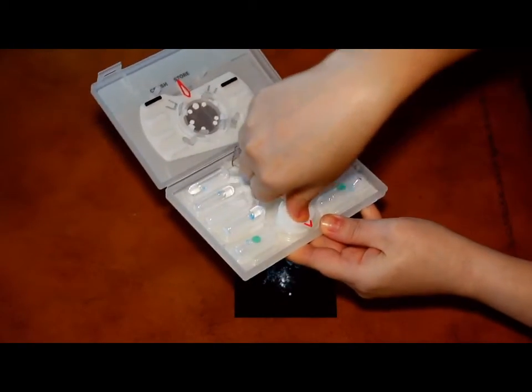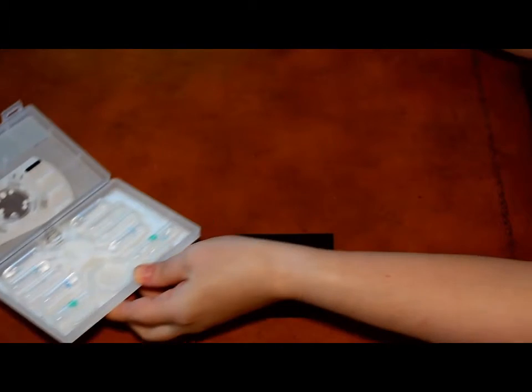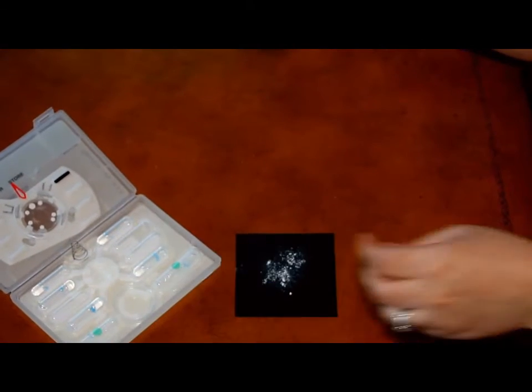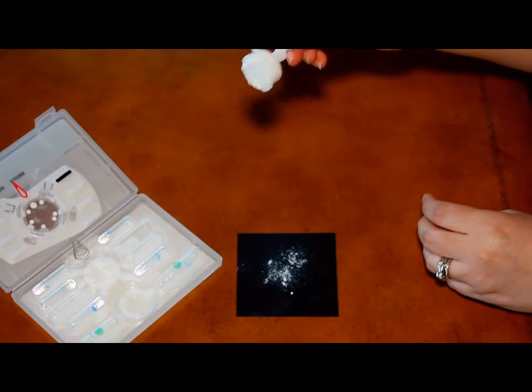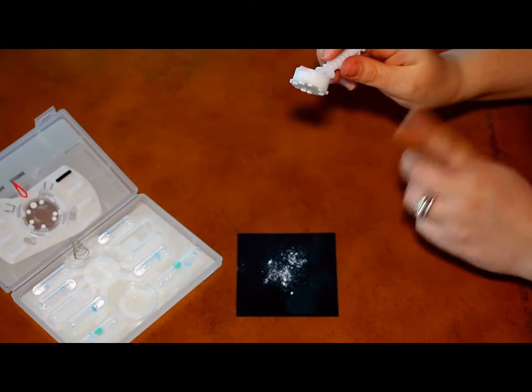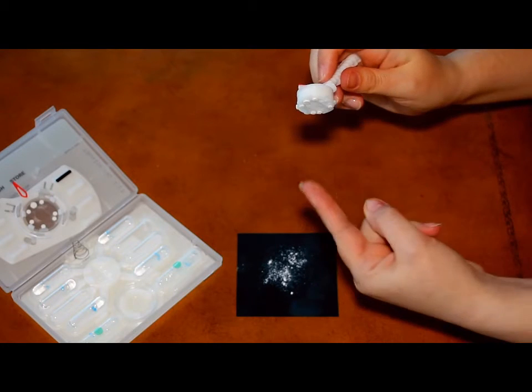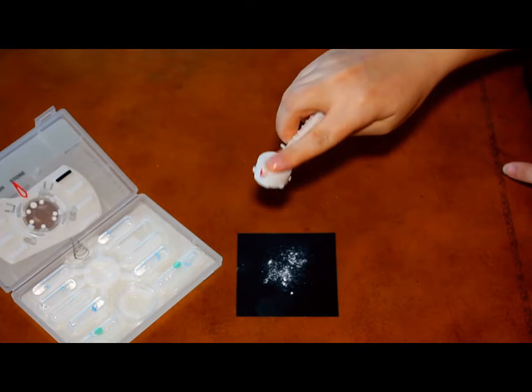After 10 seconds, press down and immediately release the collector to moisten the collector plugs. Then lift the handle and pick up the collector from the kit. Make sure not to touch the bottom of the collector — you don't want to contaminate it. Notice that there is a cover over the top of the collector, allowing you to place your finger for ease of use.